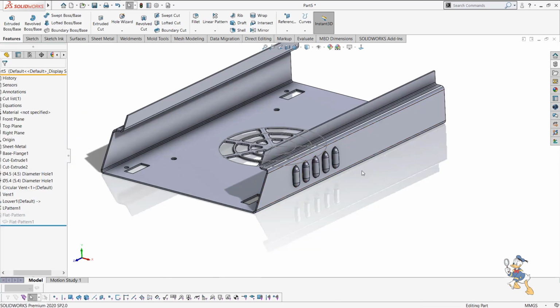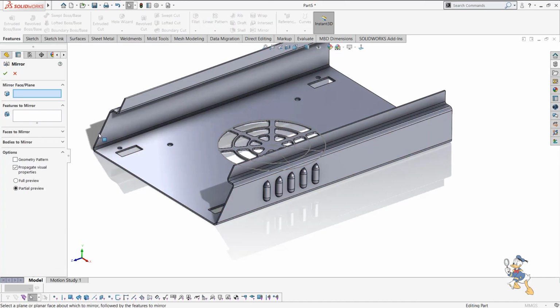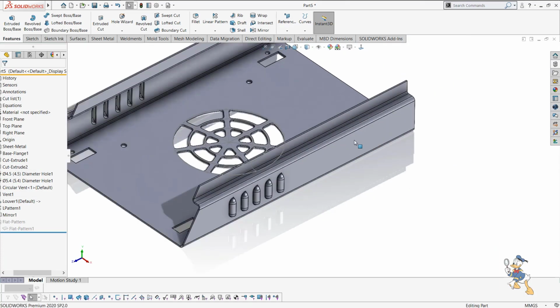And then suppose I need to generate some more features in it. Suppose right now we just need to mirror these louvers on the other side as well. So I just need to provide a plane. Yeah, this one is the plane. The feature will be a linear pattern, and we just need to check it out. So I've generated louvers on both sides of the sheet metal face.